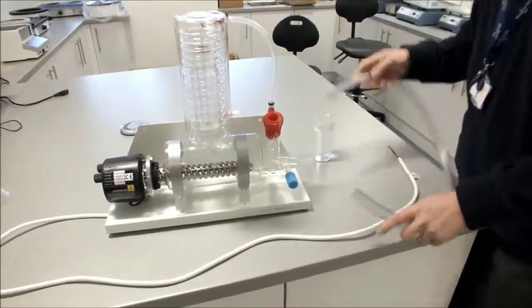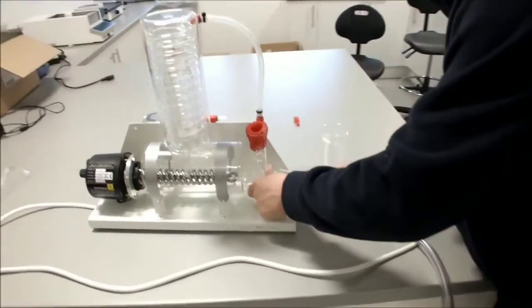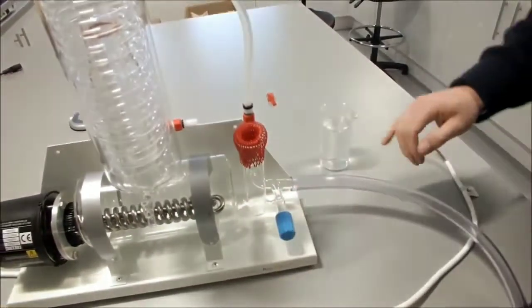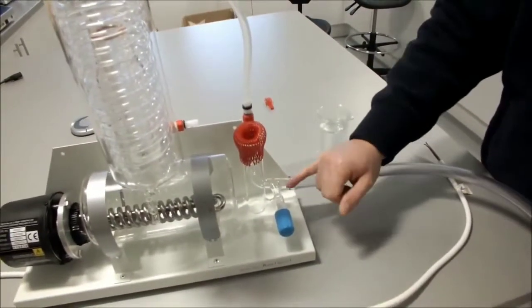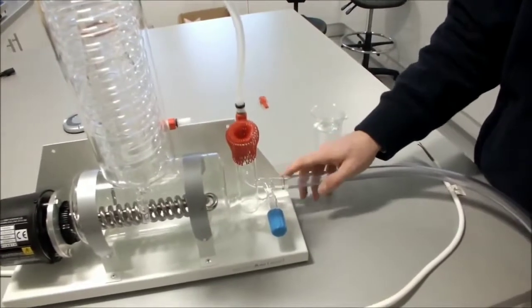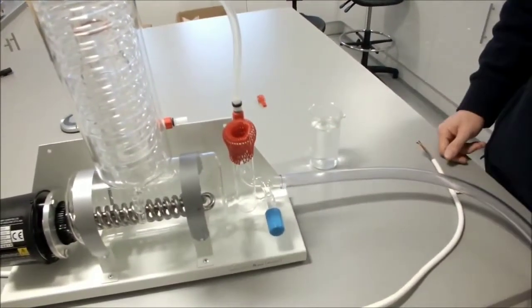And that's been in the water for a while. We then connect it onto the drain of our boiler. I've not put the tubing on fully. Obviously, you will put the tubing on a lot more and also tie wrap it using one of the tie straps provided.